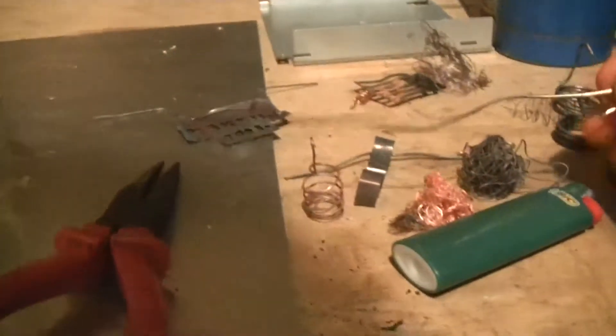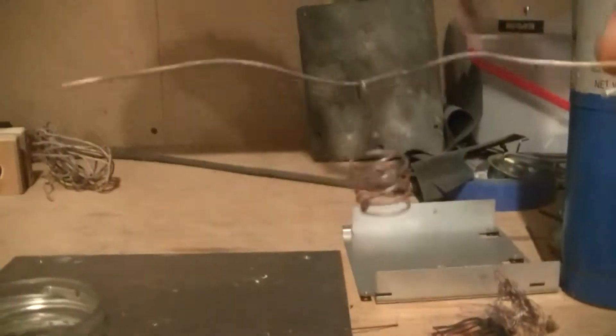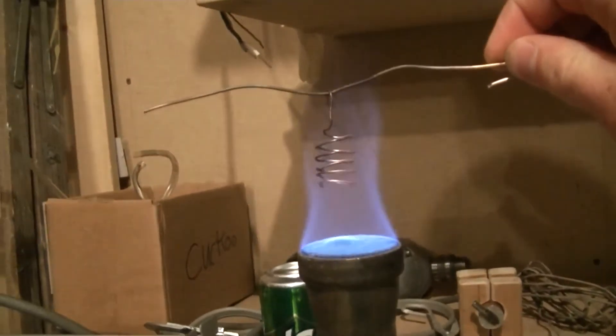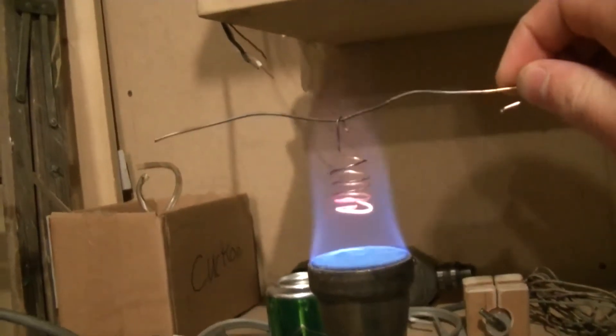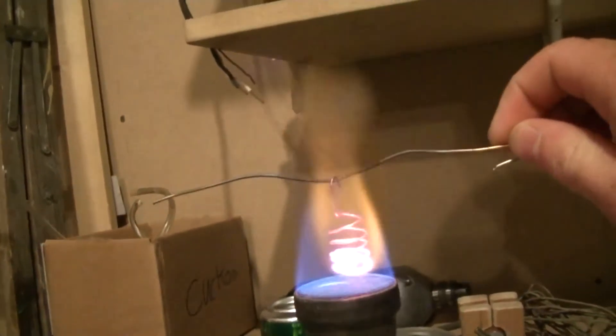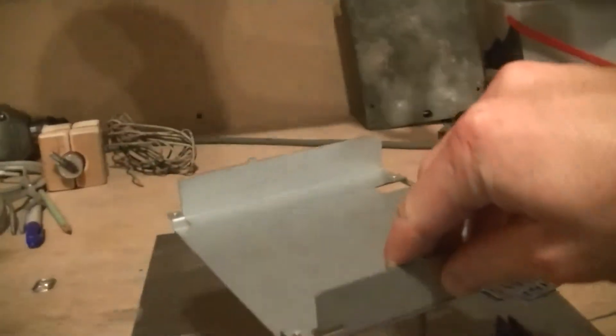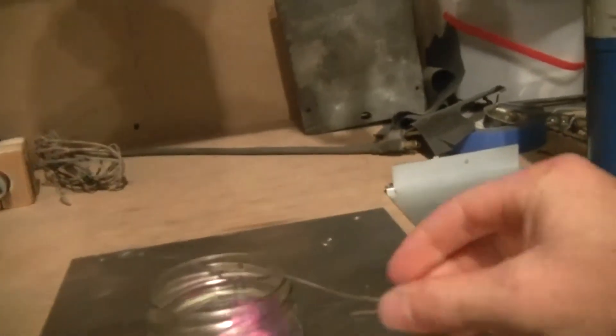I'll use this one. Basically, you just have any piece of copper will work. This is just a little copper spring I made out of some copper wire. Heat it over a flame, blowtorch or whatever you have, until it's glowing real nice. And then you just lower it in. Whoop! So yeah, there it just ignited. Just set that on top. It's still glowing there.